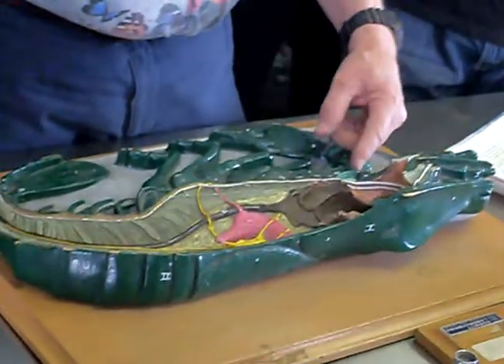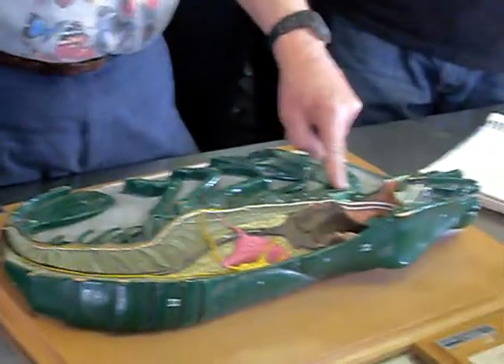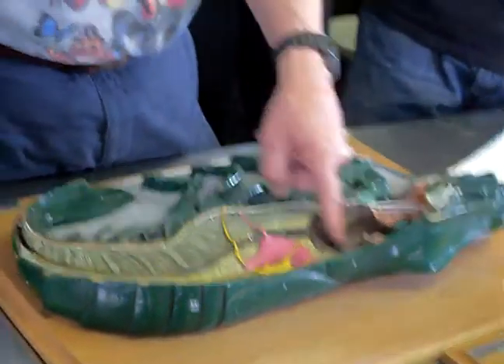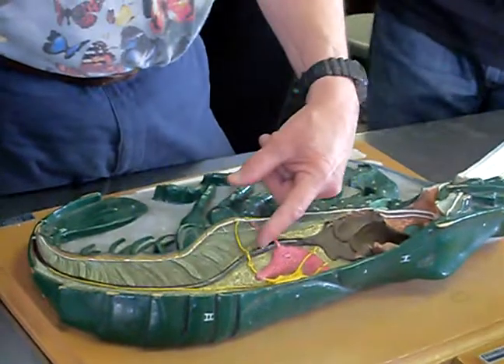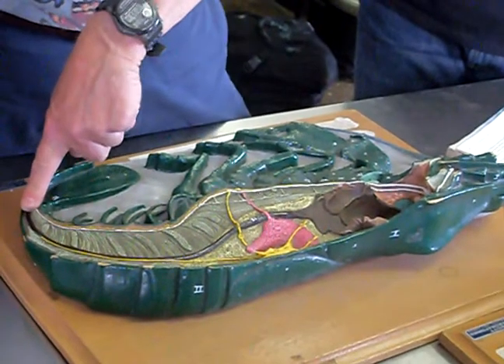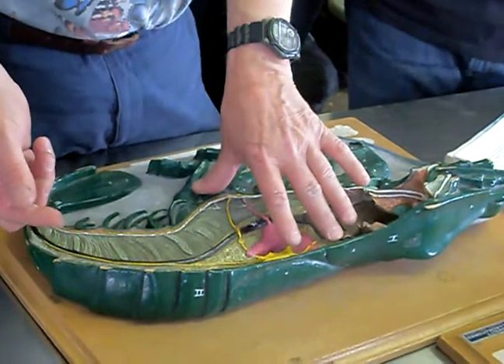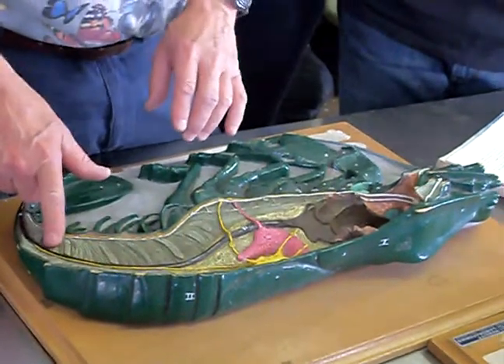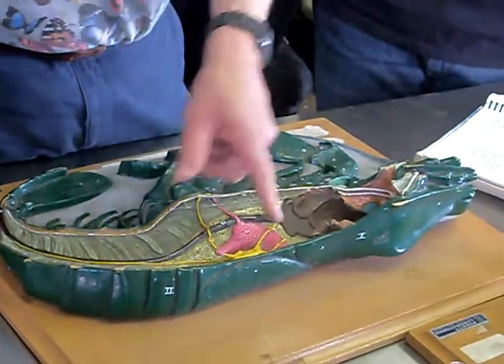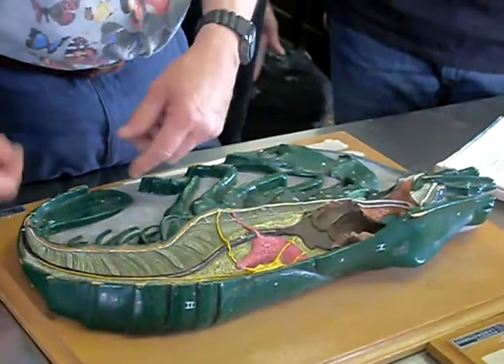As far as the digestive tract goes, we've got mouth and stomach. The mouth opens here, with mouth-part appendages to manipulate the food and move it around. It goes in here into the stomach, and then the intestine, which is the brown part you see. If this were a shrimp, this is the part that you peel out — they call it the vein, but it is not a vein. It is the intestine and it's full of waste, so that's why you want to get rid of it. We usually cut that part out.